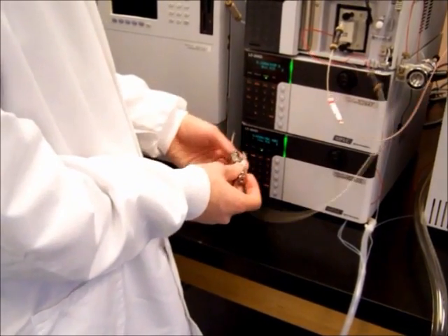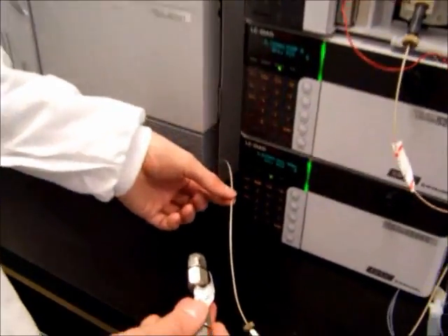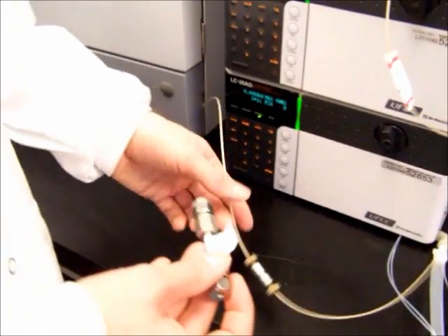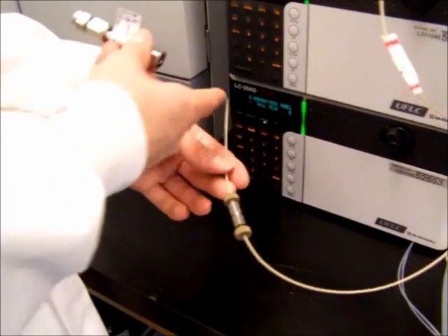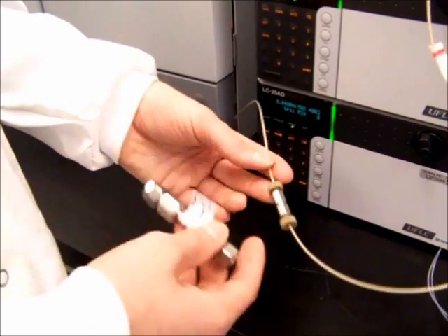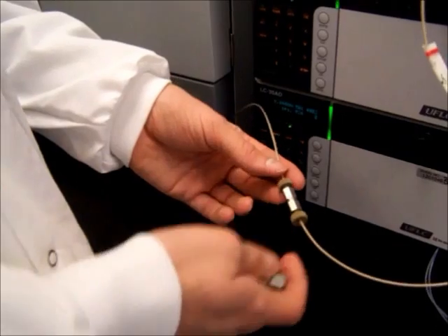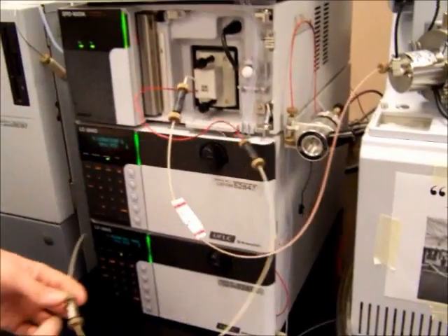The column attaches here. When the LC-MS process is taking place, at this point, the solvent has been pre-mixed and it's moving through. The solvent and the analyte have come together. They're mixed together and when you reach this point, this is where the separation occurs with the column. And if you'll notice, it's right before the PDA, so it feeds into the PDA here.